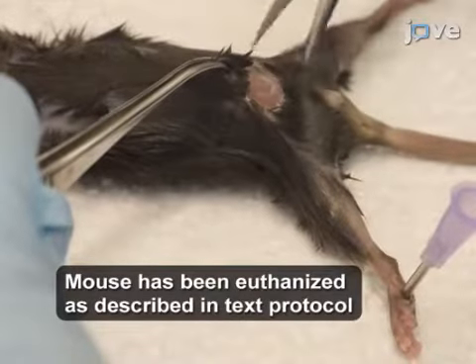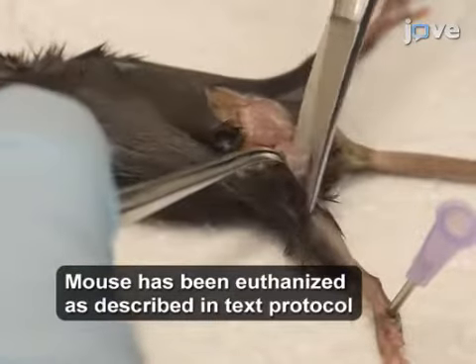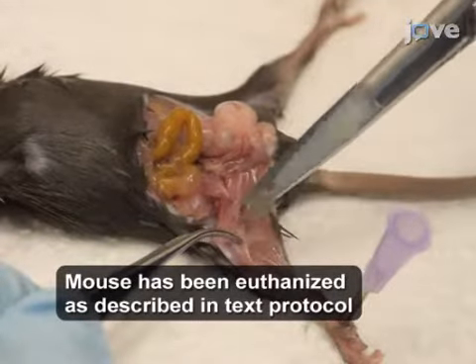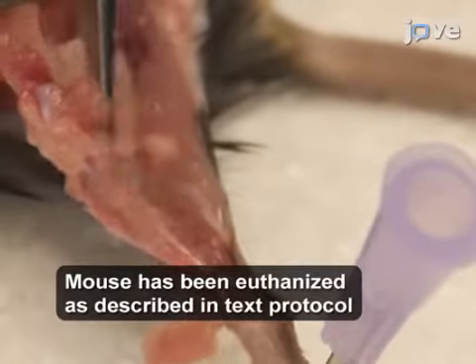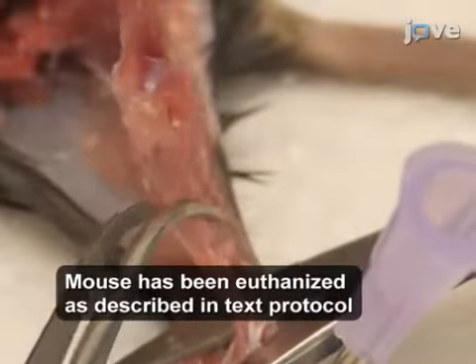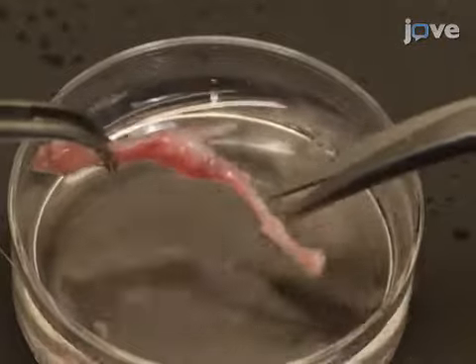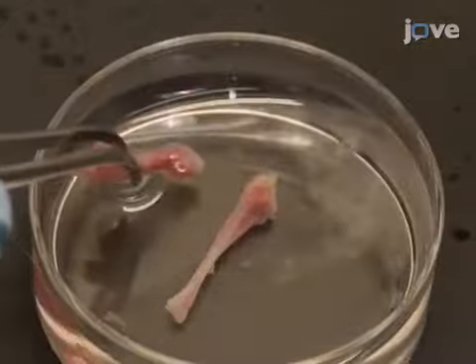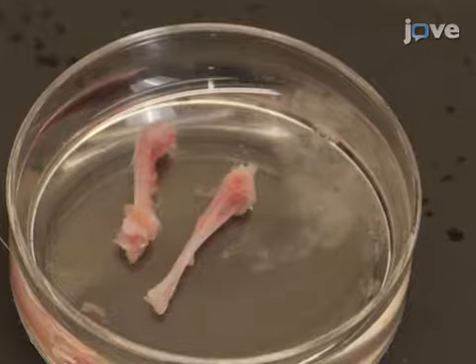With dissecting scissors, make an incision in the skin and dissect the fascia from the leg muscles. Then, dissect the leg away from the mouse by severing the femur at the hip and the tibia at the ankle. Bend the leg into an L shape and use dissecting scissors to separate each leg bone by cutting at the knee joint. Then, gently scrape the muscle towards one end of the leg bone until the cartilage is disengaged.